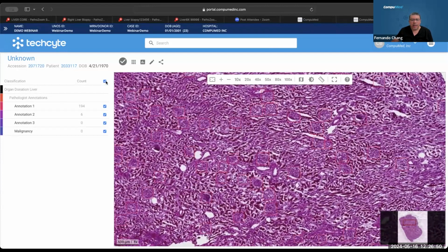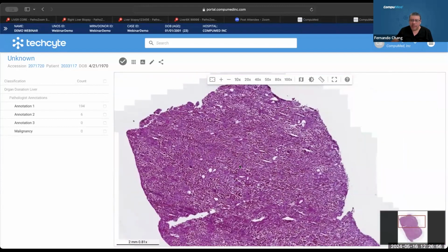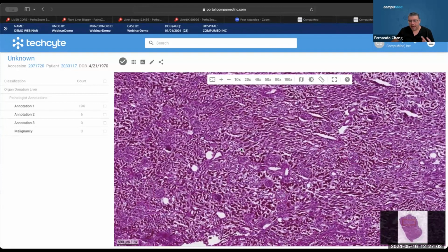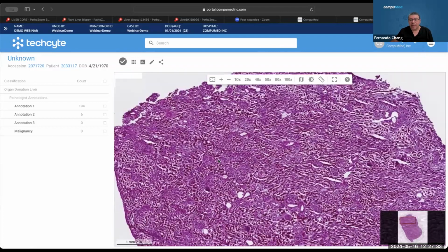Okay. Thanks. And I have this as a wedge biopsy, and you can see there are 2 problems here. The first, this was reported by a pathologist as overstain. And again, we know that this is not actually overstaining, because most of the stainers, and it's a good thing, in so many places like SDA, they have this automatic stainer. So the staining time on each solution is automated now. So we have that standardized. We cannot blame the operator for leaving the tissue or air drying or something. It's a standard. But what happened here is that this section is too thick. And because of the thickness, it gives us this impression of overstaining, but really it's not.